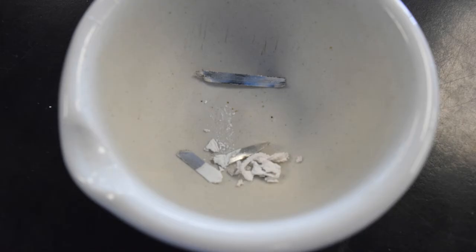In this image we can clearly see the difference between the original solid magnesium and the new solid magnesium oxide. The image at the top is the example of the original silver colored solid magnesium whereas the white solid at the bottom is the magnesium oxide.